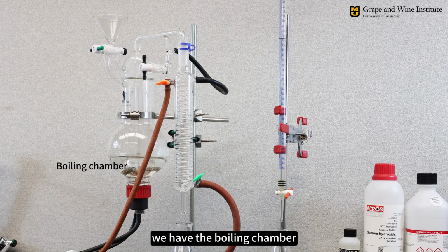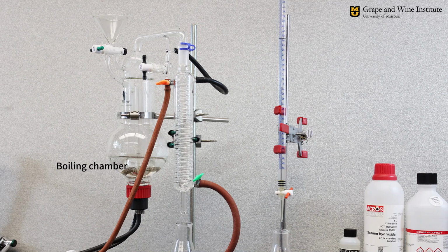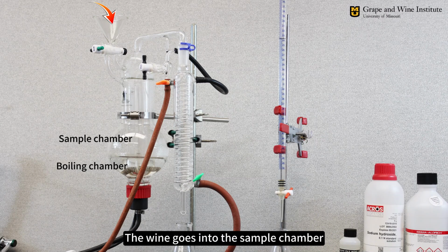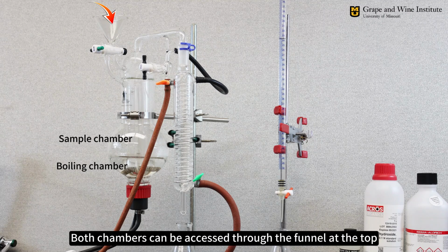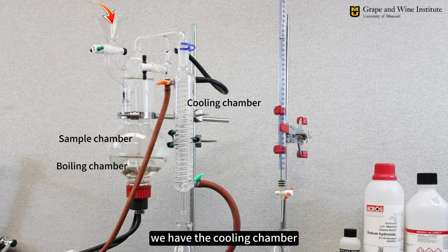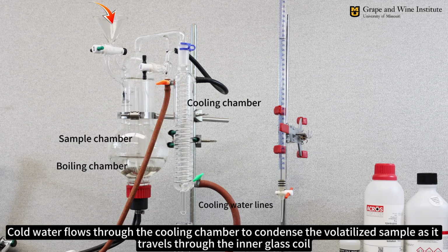On the left, we have the boiling chamber. Water needs to be added here to heat up the wine and volatilize the acetic acid. The wine goes into the sample chamber, which is located within the boiling chamber. Both chambers can be accessed through the funnel at the top. On the right side, we have the cooling chamber. Cold water flows through the cooling chamber to condense the volatilized sample as it travels through the inner glass coil.